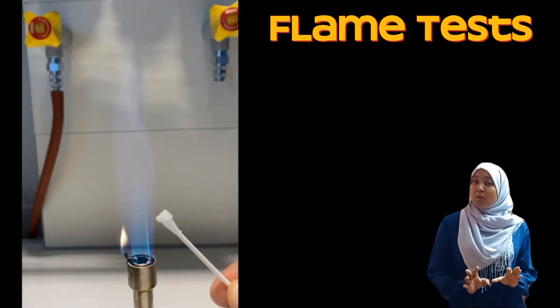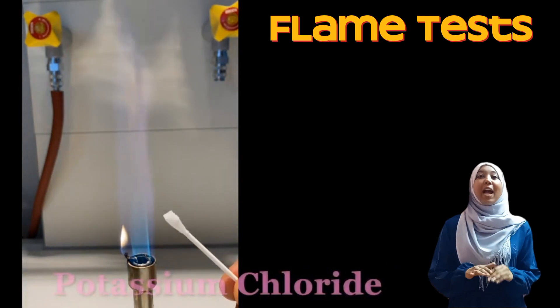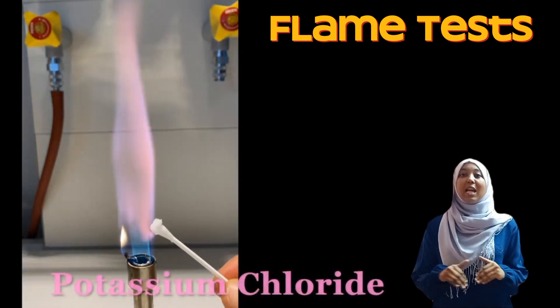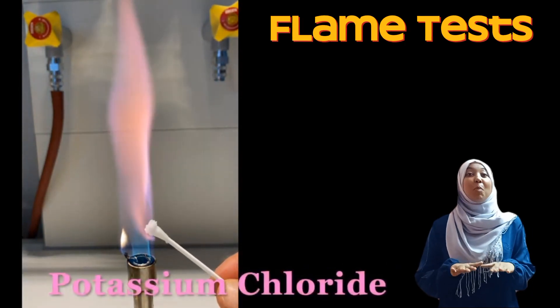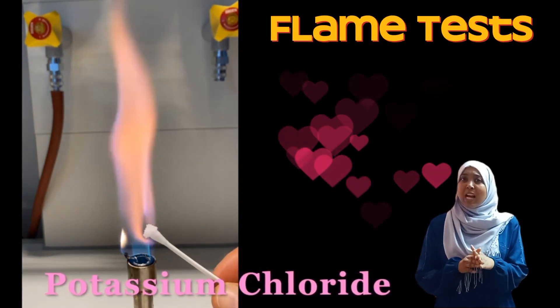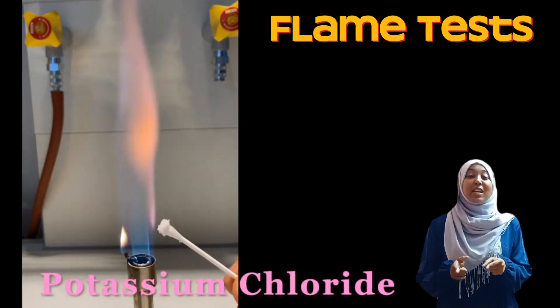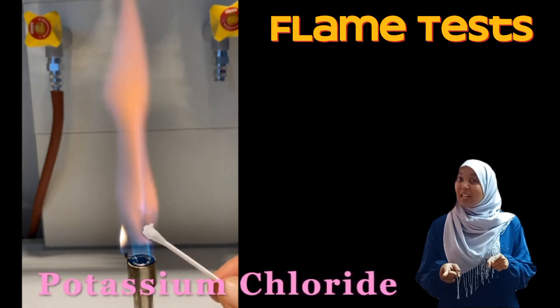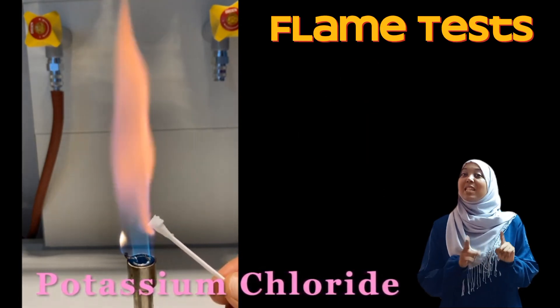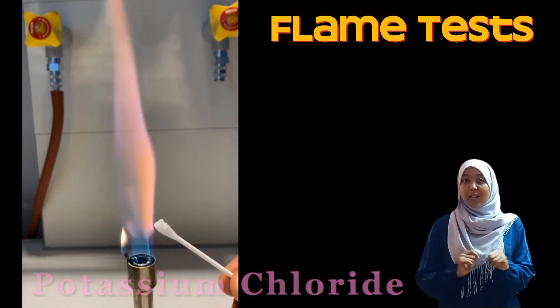Moving on to potassium. I have to say this is my favorite. Look at how beautiful that color is. In case you're wondering what color this is, it is lilac, or a pale purple color.